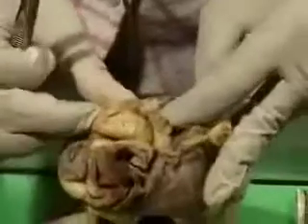The left atrium, this is the auricle, and then these are the pulmonary veins which are opening into it. When you open up the left atrial wall, you can see most of it is smooth, and the only part which is rough is the part which is present in the auricle. So I'll cut this so that you can see that.